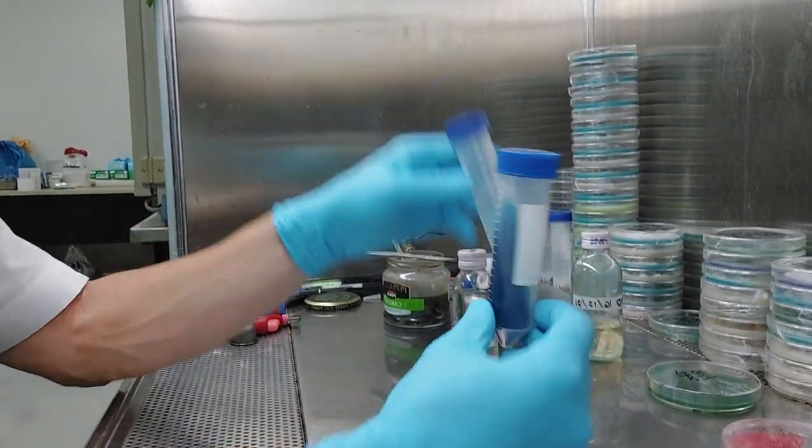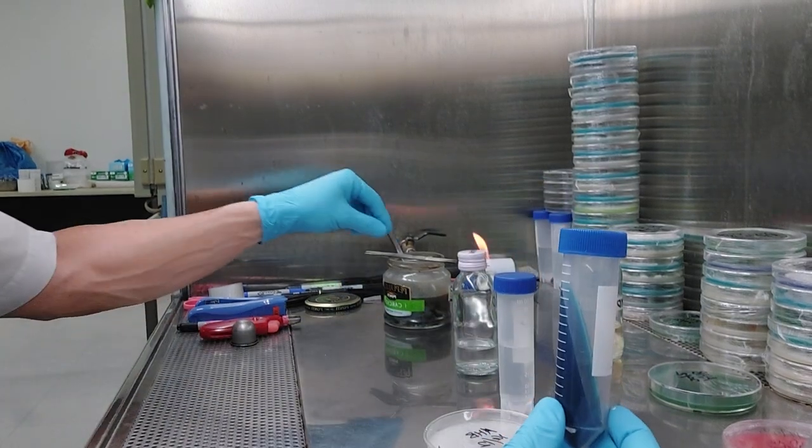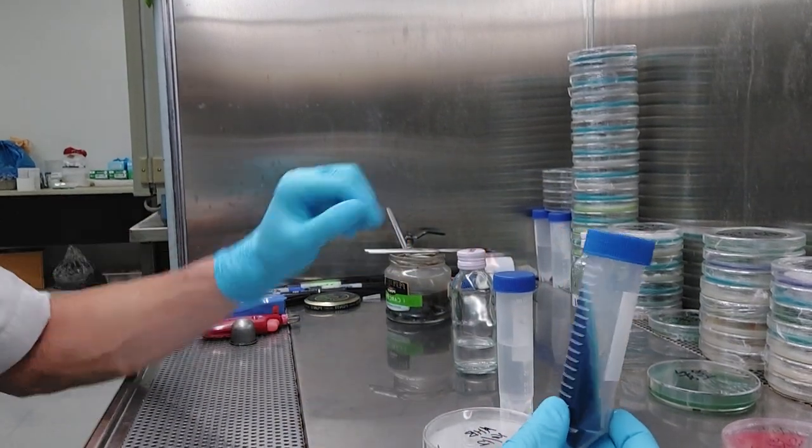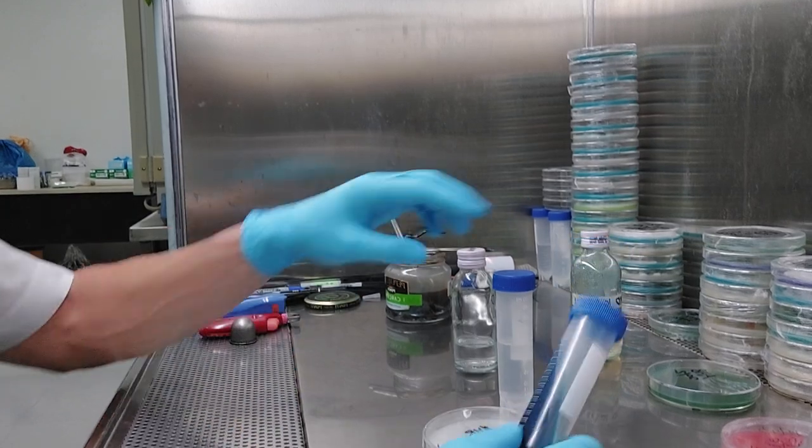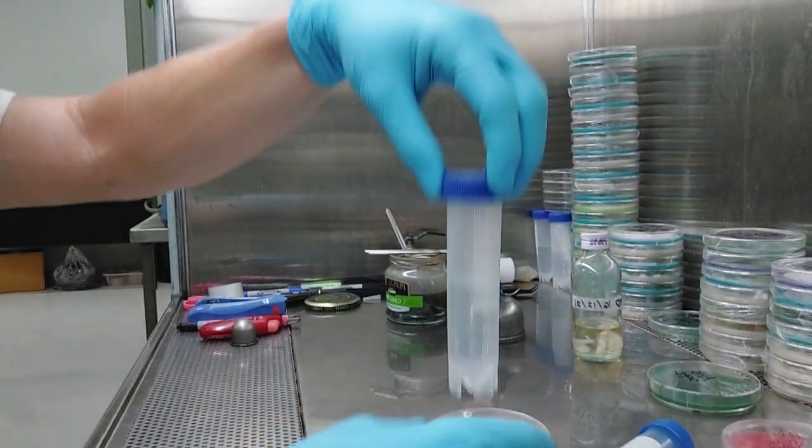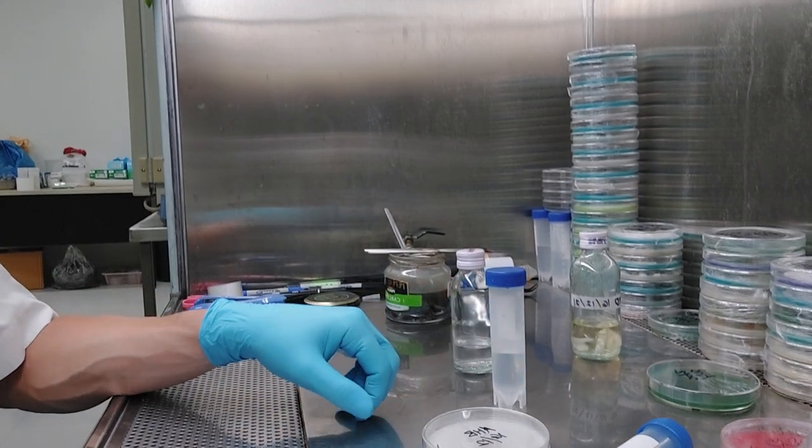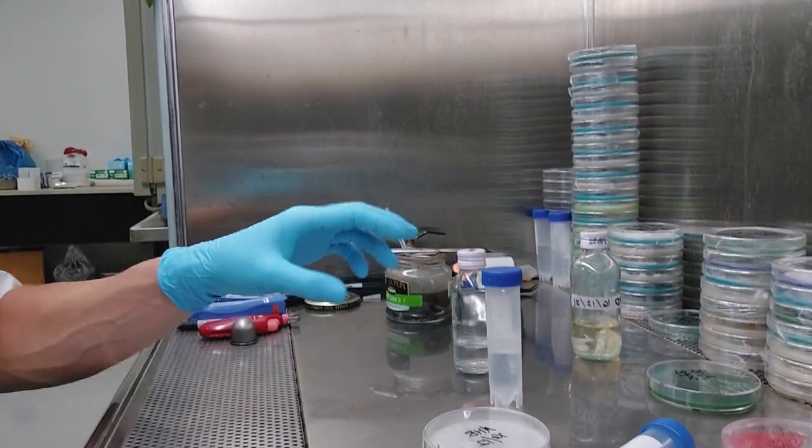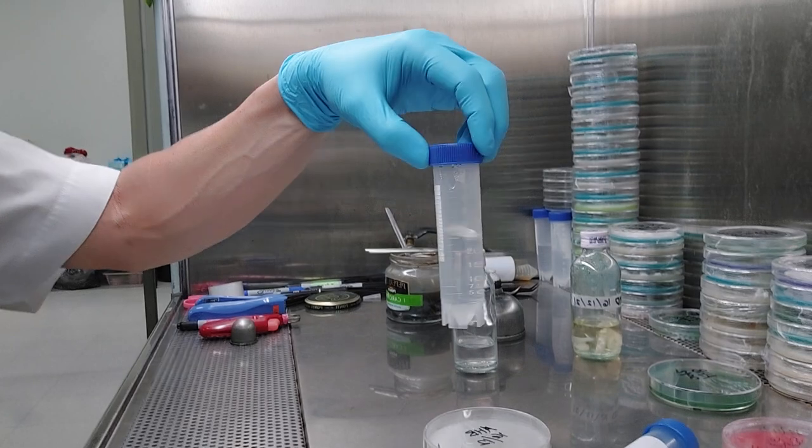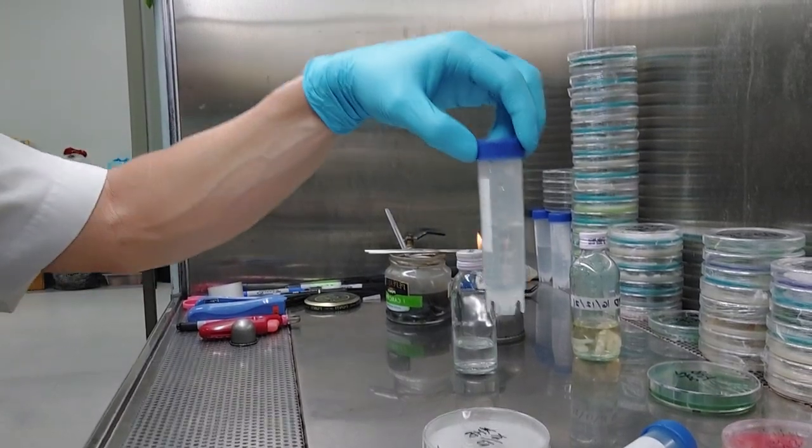You guys, this is the simplest. Slants are great, but slants are really meant for you to basically kind of keep in the fridge and pull out like maybe every six months, every year. These water vials, if you keep them stood up in a relatively undisturbed place, they're not shaking around, you're not shaking them and they're not contaminated. These will literally last for years, you guys. I'm telling you, it's dead simple.